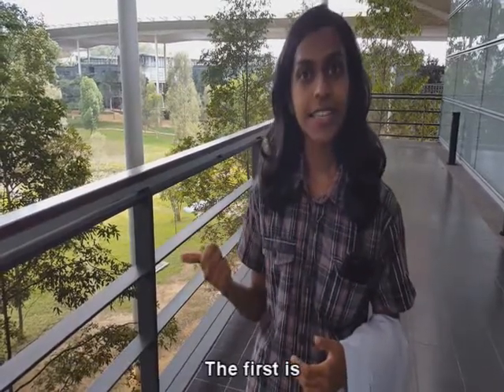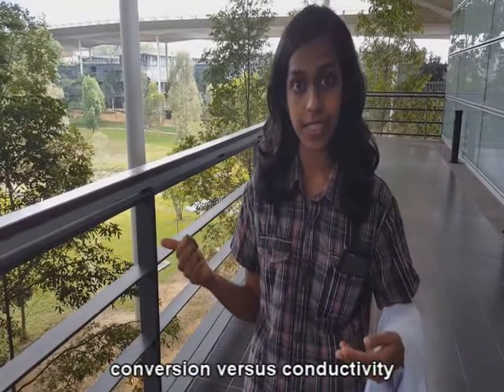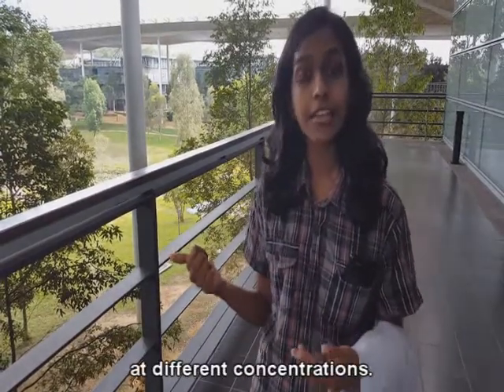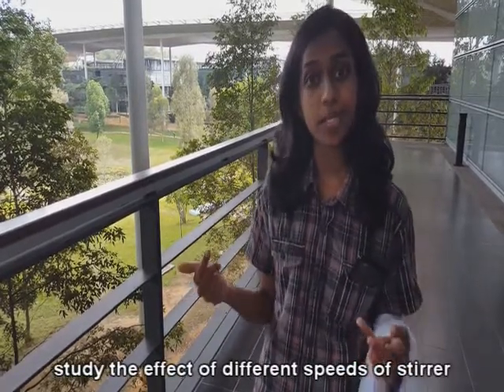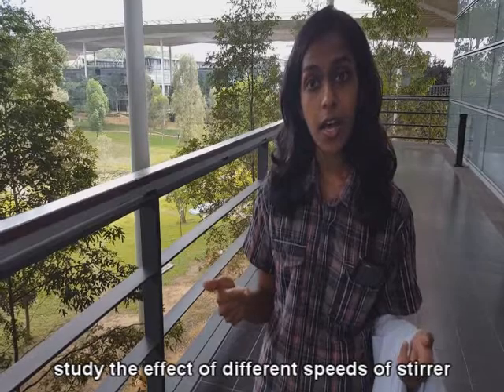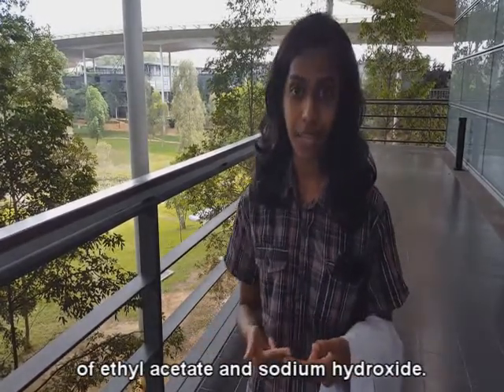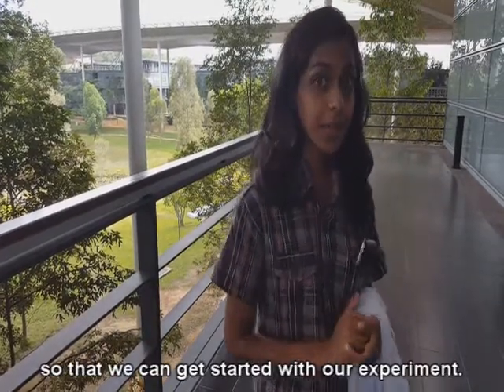The first is to prepare a calibration curve of conversion versus conductivity for ethyl acetate and sodium hydroxide solutions at different concentrations. Second is to study the effect of different speeds of stirrer on the batch saponification of ethyl acetate and sodium hydroxide. Now, let's go into the lab so that we can get started with our experiment.